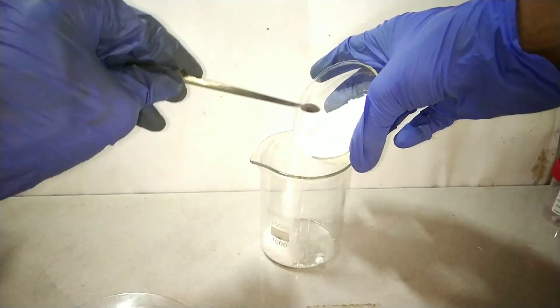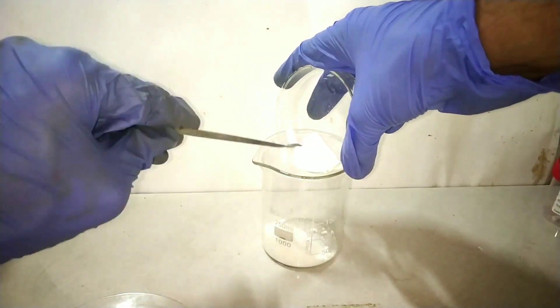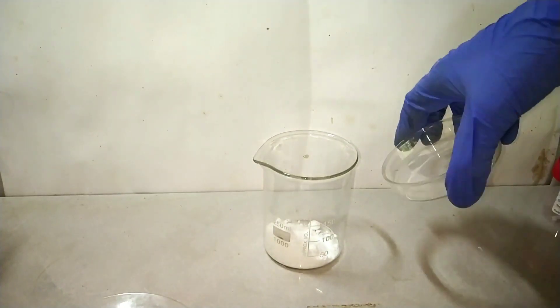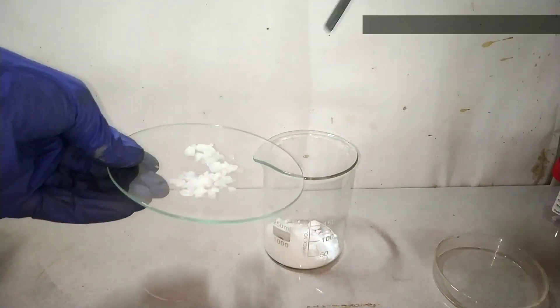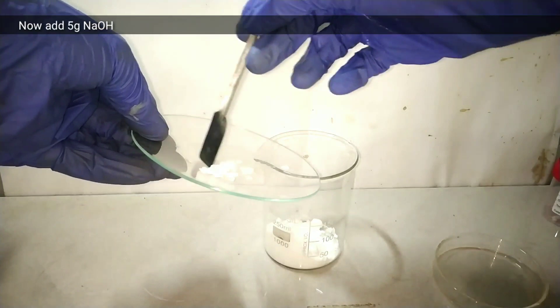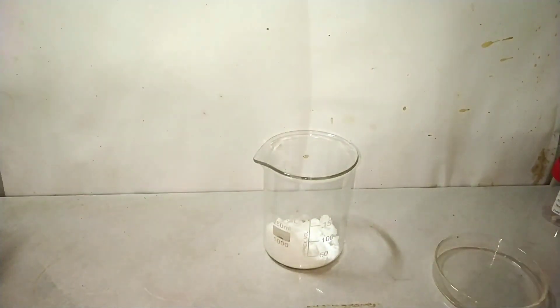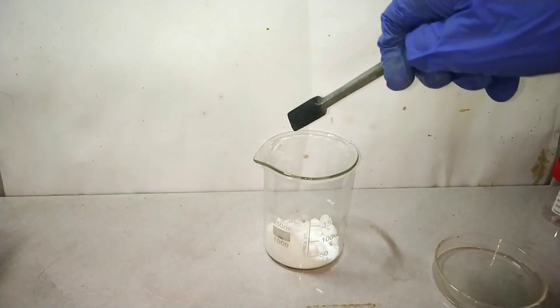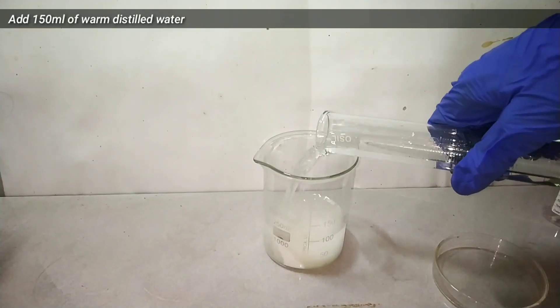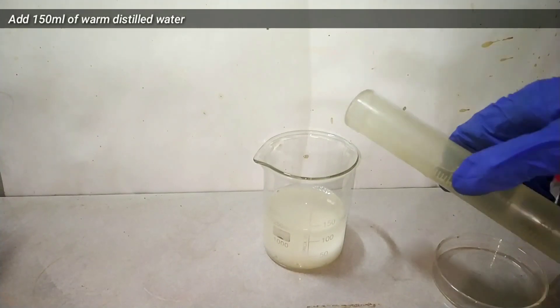Start by taking a 250 ml beaker and transfer the pre-weighed 24 grams of borax into it. After transferring the borax, add 5 grams of pre-weighed sodium hydroxide into the same beaker. Then add 150 ml of warm distilled water to dissolve the contents.